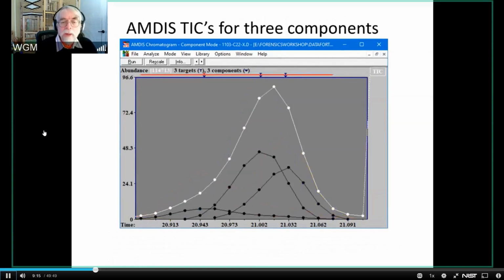So given that, the other thing I want to point out is that in addition to identifying that there are separate compounds, AMDIS also tells you exactly what the area of the TIC would be if that was the only compound present. So for this component, this would be the TIC if only it was present. For this component, this would be the TIC if only it was present. And for this component, this would be the TIC. So you not only can get identification, but you can get areas.